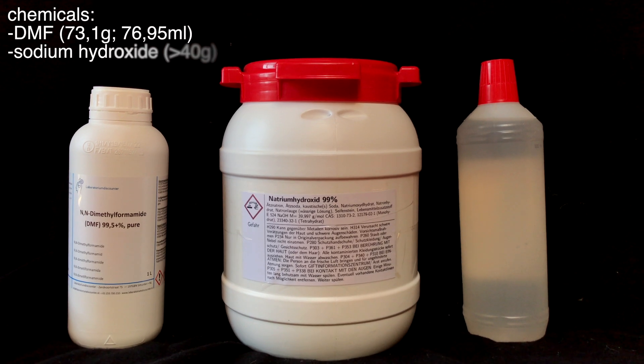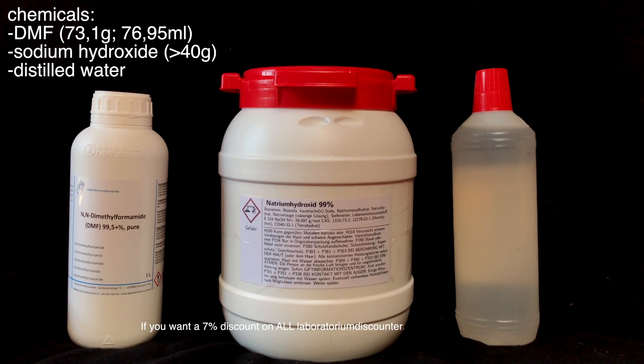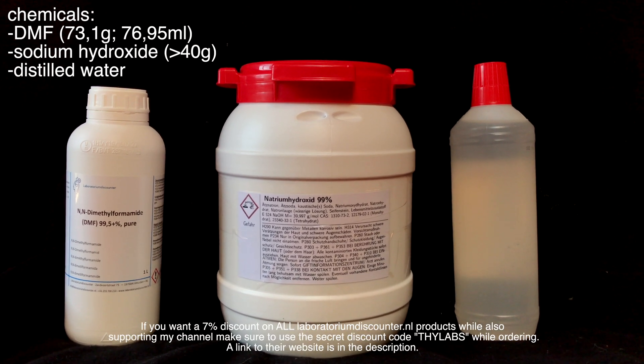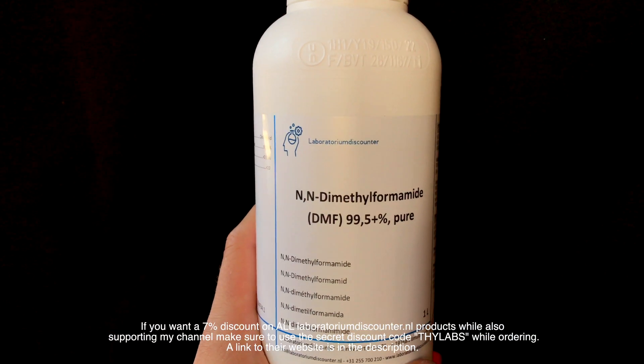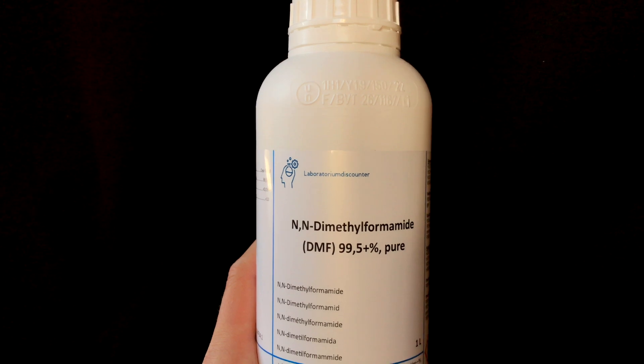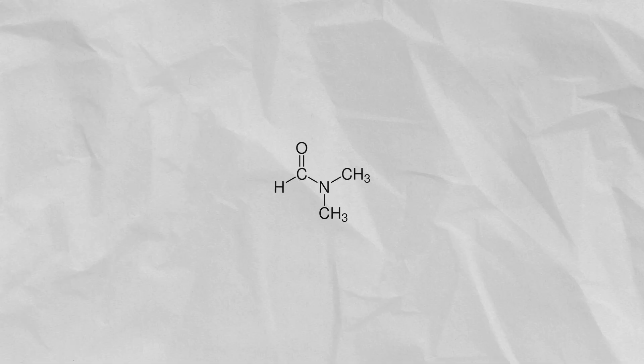The chemicals for this preparation are quite simple. We need DMF, sodium hydroxide, and distilled water. The DMF is the most important reagent. We want dimethylamine, and DMF already contains that dimethylamine group.